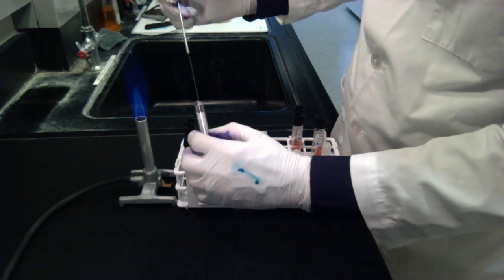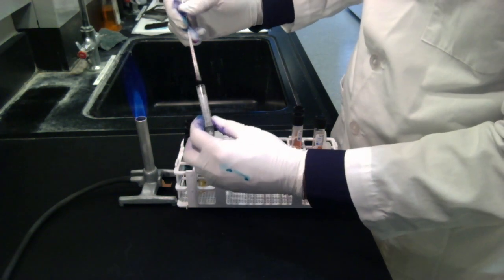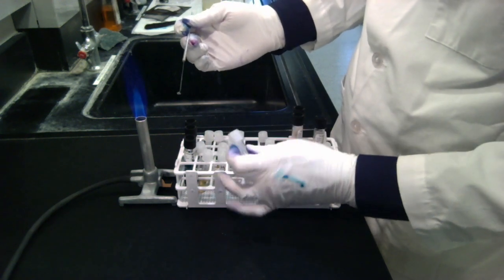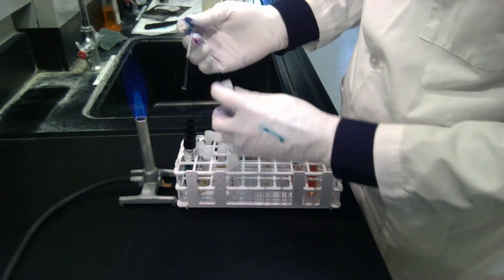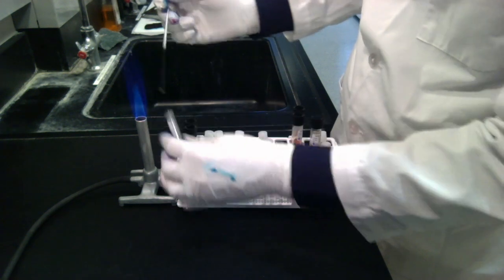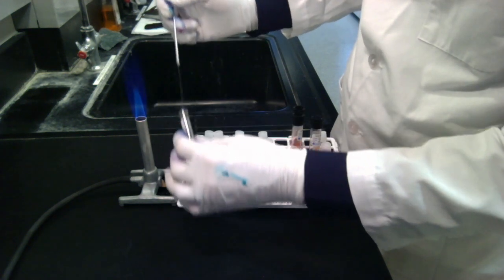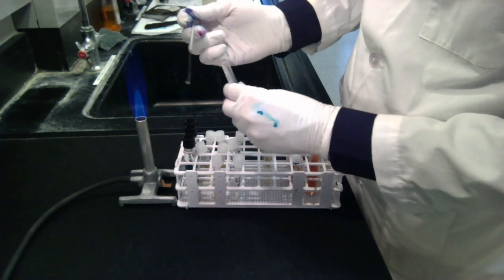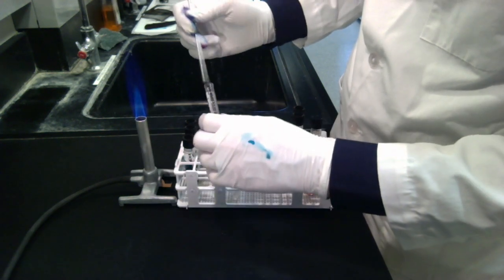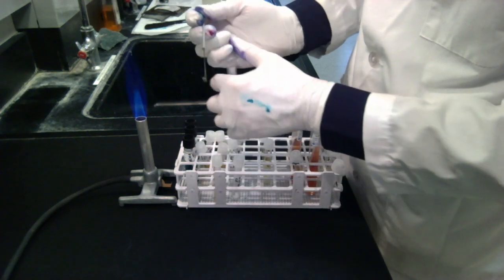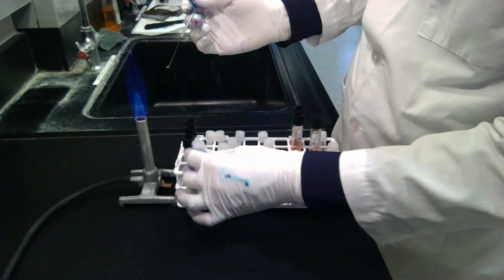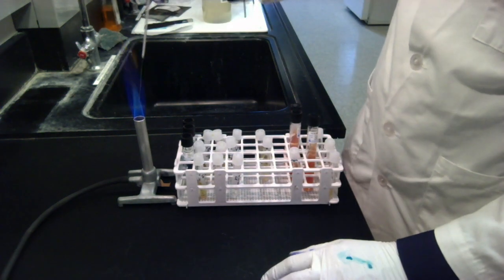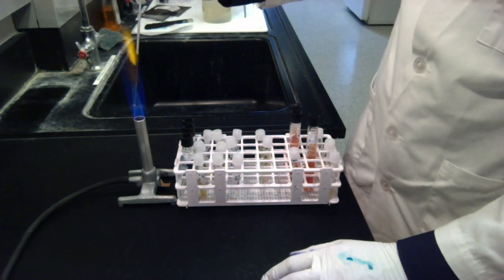So I'm going to go in here and just squish it around. That's one. Loose cap. We should still have enough for this one. Loose cap. We should still have enough for this one. Loose cap. So those three I just did with one scoop.